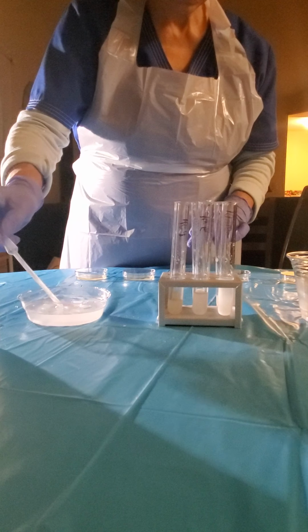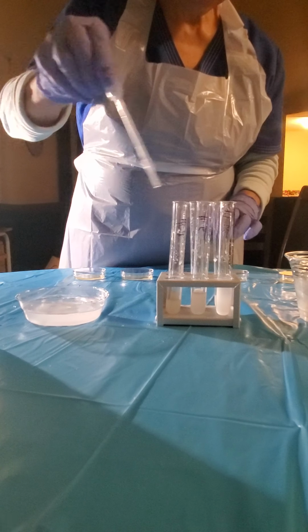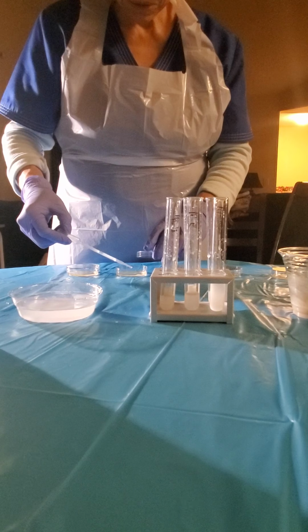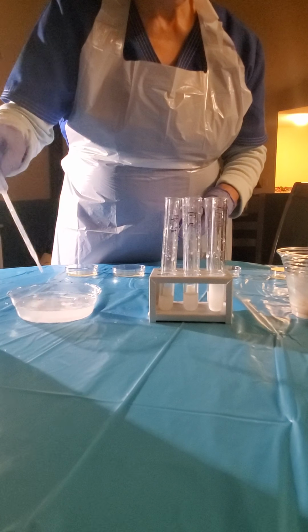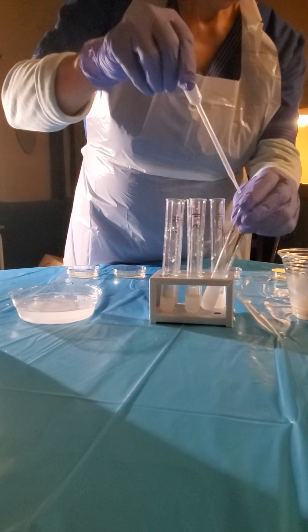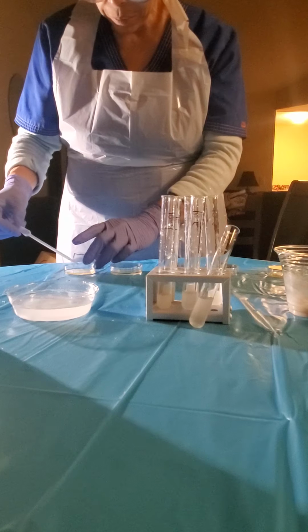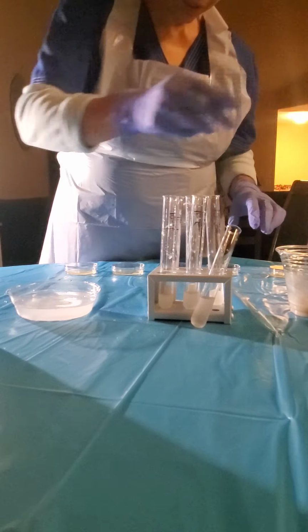Four drops. Number 5. Same process. You want to be sure. This is number 6 of the dilution. Tilt it a little bit, 2, 3, 4.